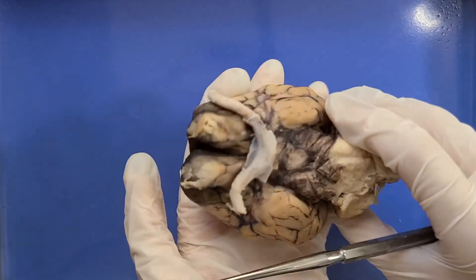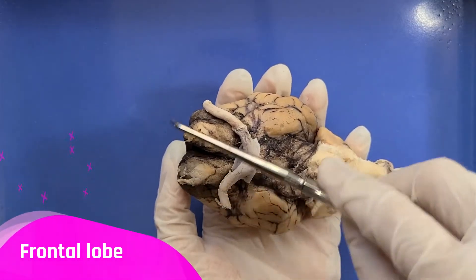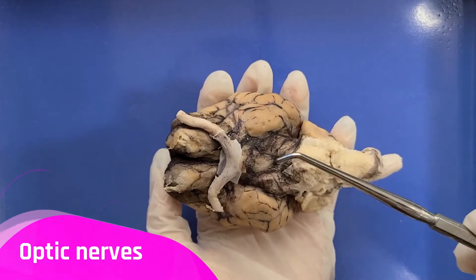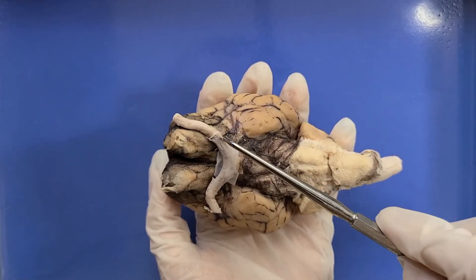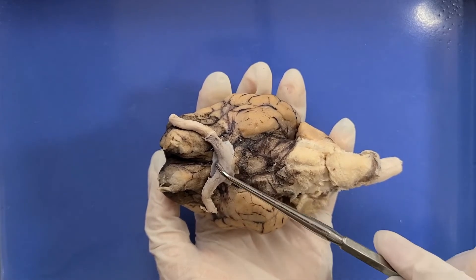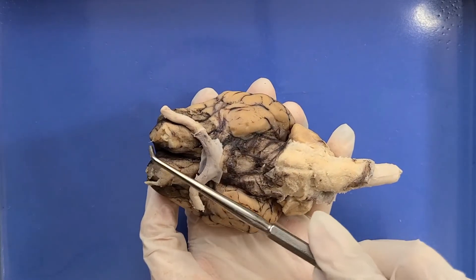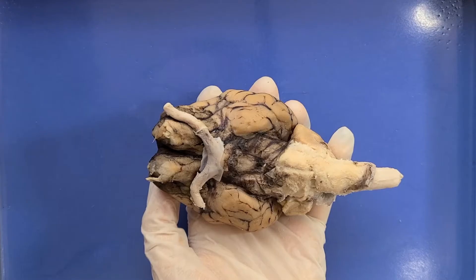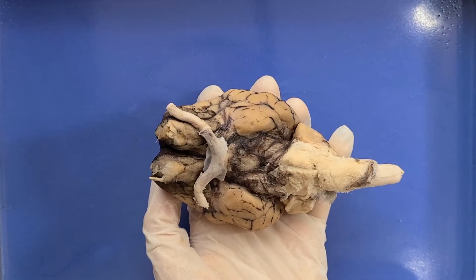When I flip it over, you can see parts of the temporal lobes and also parts of the frontal lobe — we'll discuss these more later. These two things here are the two optic nerves, which come from the eyes. You can imagine the eyes are located around here, and the optic nerves bring that information all the way back here, which is where vision actually gets processed. Where these two nerves cross is called the optic chiasm. These two lumps here are the olfactory bulbs, which transmit information about smell from your nose to your brain — an extension of the nervous tissue of the brain that extends to the roof of the nasal cavity.